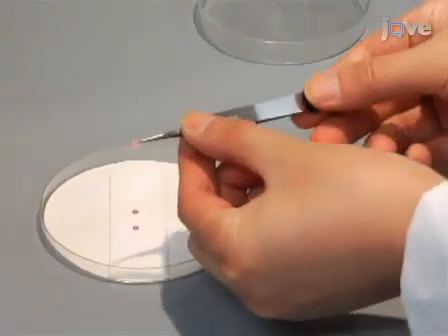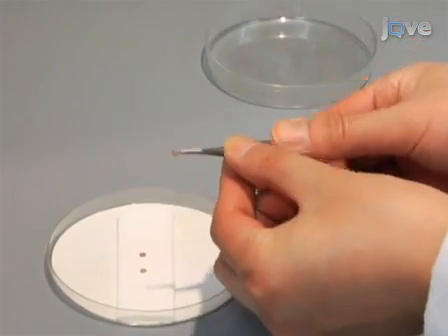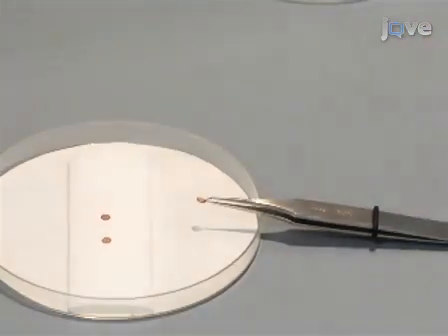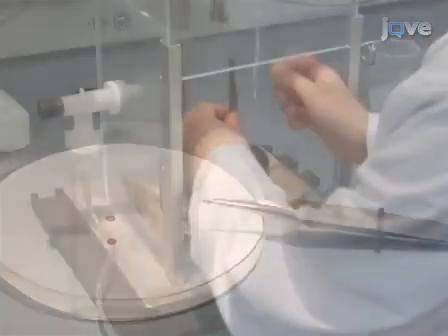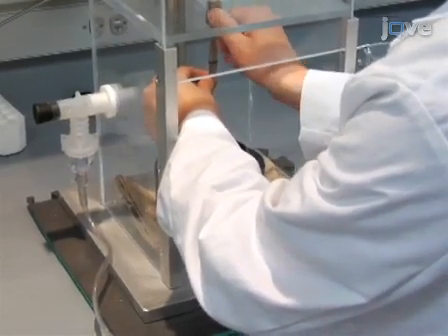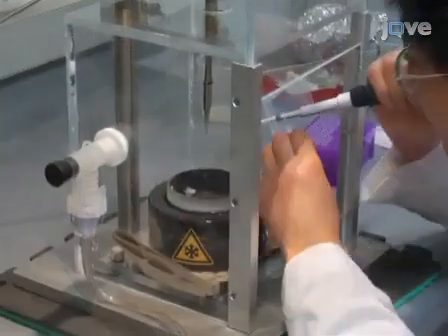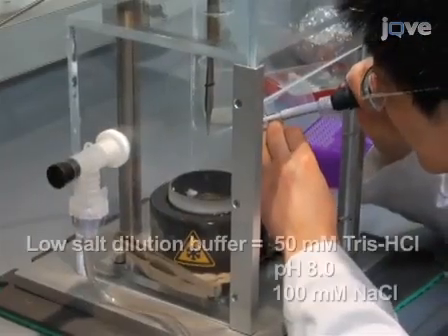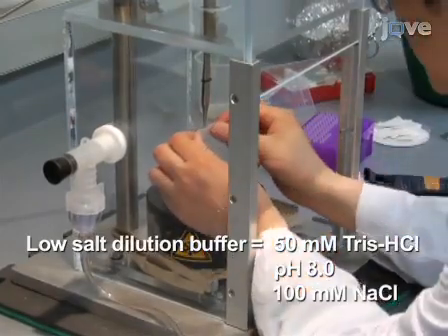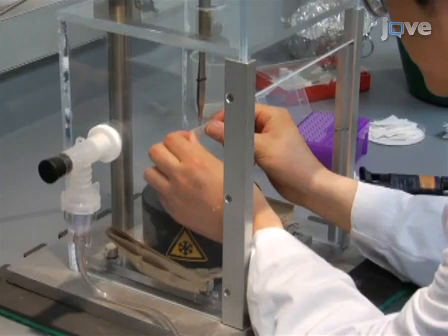Next, use forceps to clamp the pincers closed onto the grid edge. Apply 2.5 microliters of a pre-assembled protein solution onto the carbon side of the grid. Then load the forceps onto the plunger with the carbon side of the grid facing away. Add 3 microliters of low salt dilution buffer to the back side of the grid. Immediately blot the grid with a piece of filter paper on the same side.